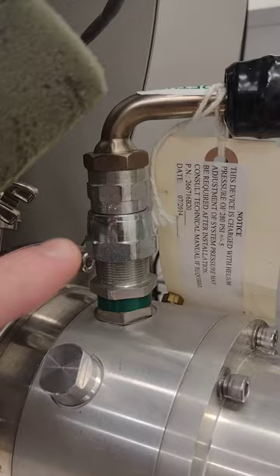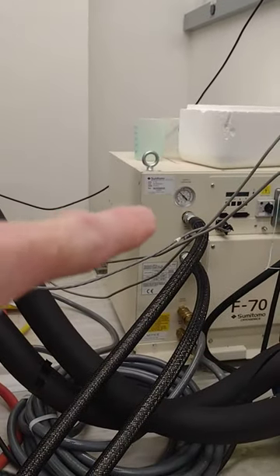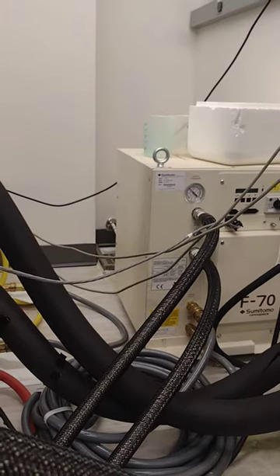Hold that tight, loosen this, then hold that tight and loosen this until your hose is off. Then do the same with the other hose — exact same rule set. And the same applies over by the compressor pump way over there — same rules apply there.